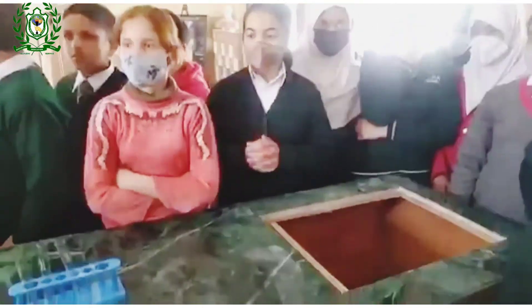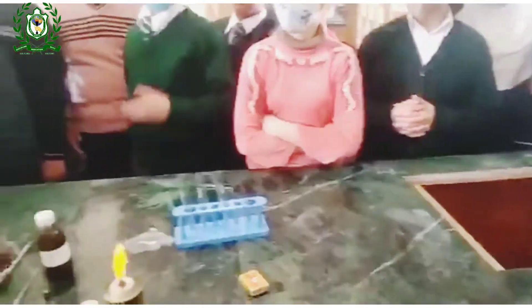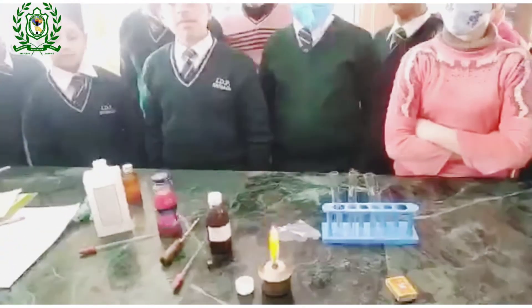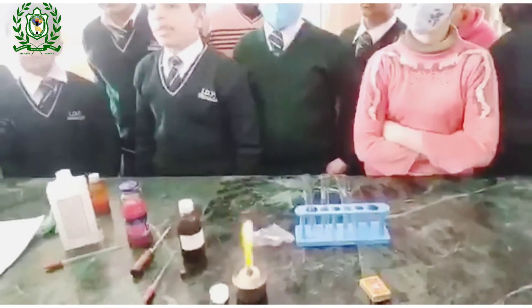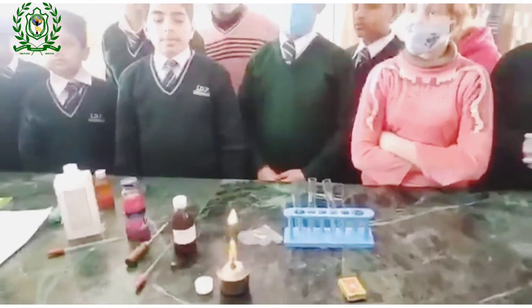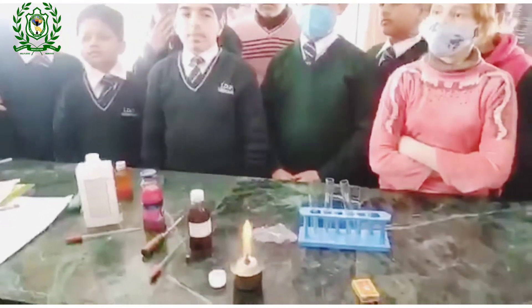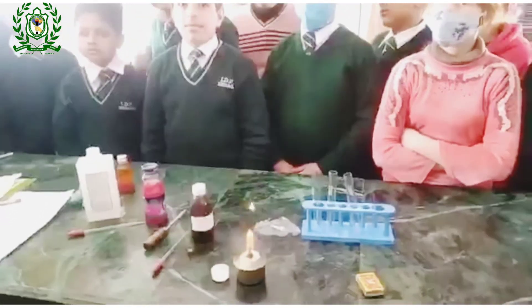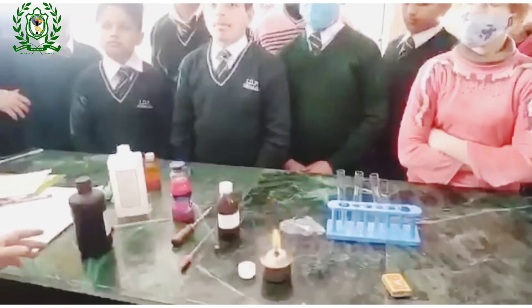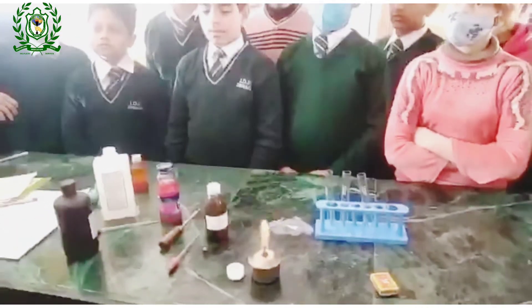But when the sugar quantity is medium, the color changes to yellow. If the sugar quantity is high — it has a high sugar content — then the color changes to red.